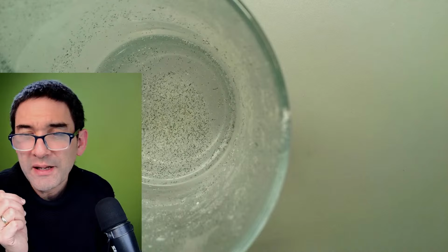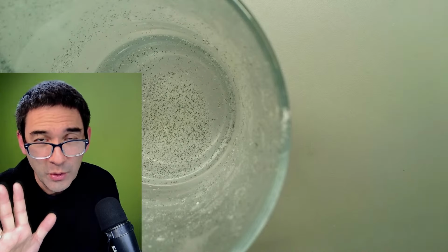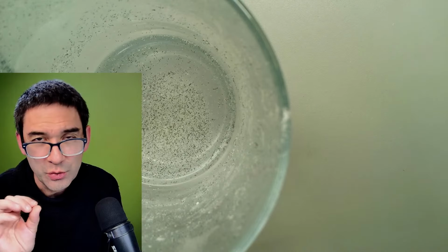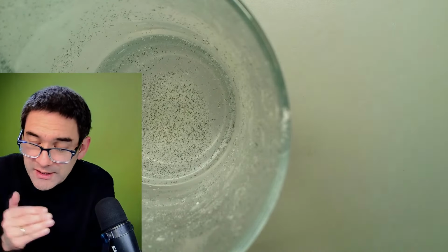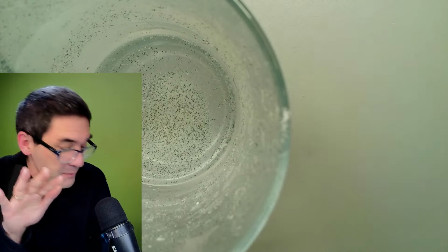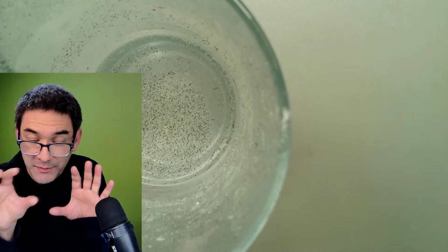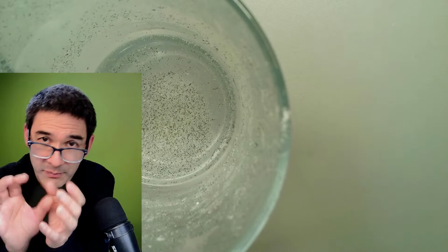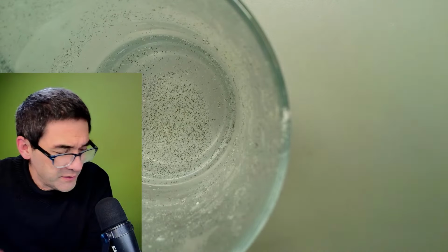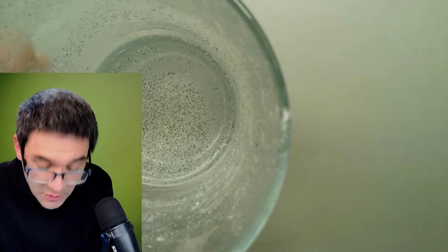Kids flavored toothpaste with the colorings, yeah, we can check, but I'm kind of worried that you will not be able to see a huge difference, no structural things, because if it's homogeneous, then it will look all the same, and there will not be anything interesting to look at unless they added something to it, or unless there is some kind of oil water mixture, which I think toothpaste does not have, but face creams do. It's an emulsion, yeah. But I'll check.